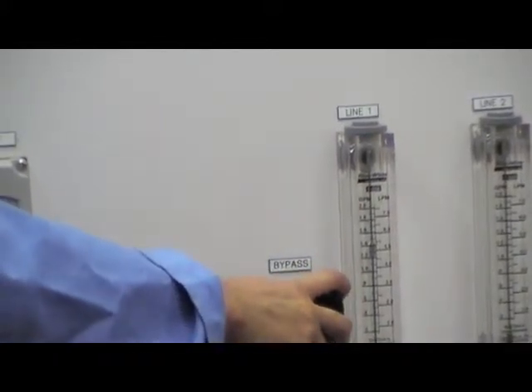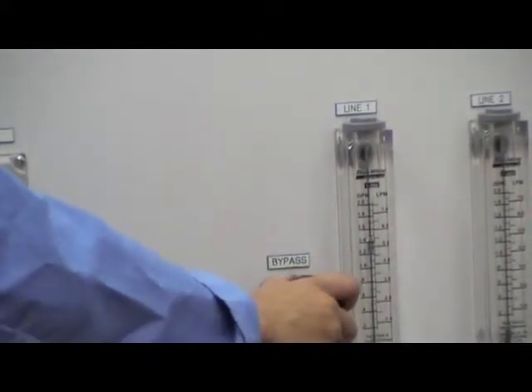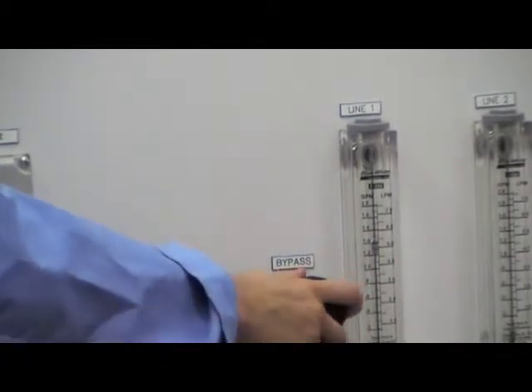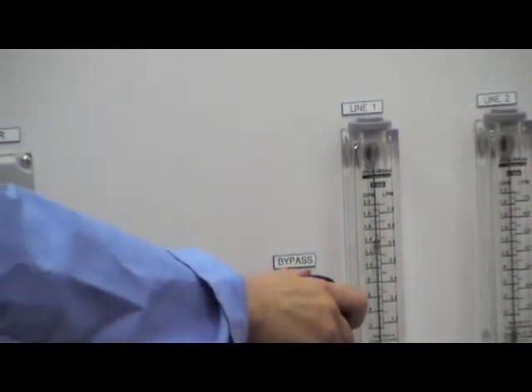You will notice the sound of the motor might become louder and this is an indicator that your flow is starting to increase as the motor is working harder.